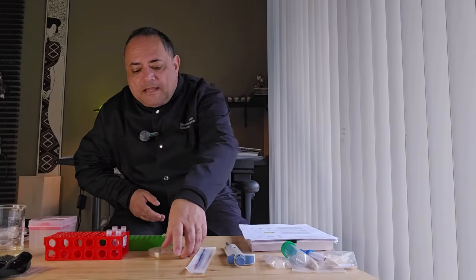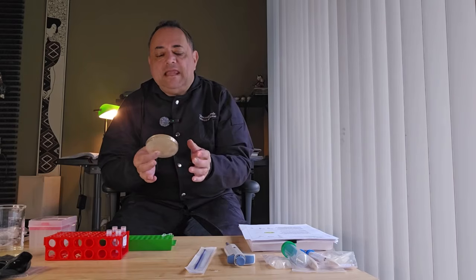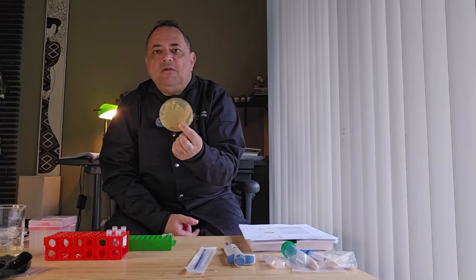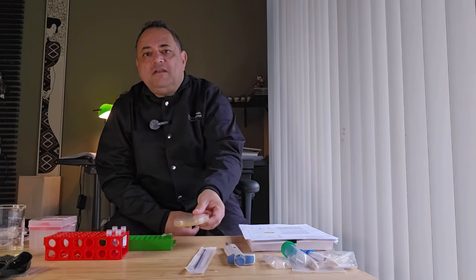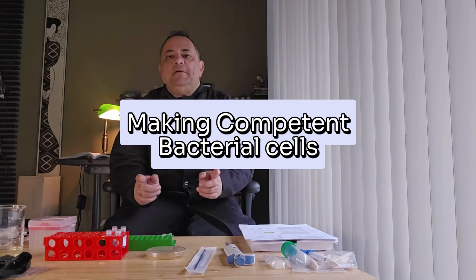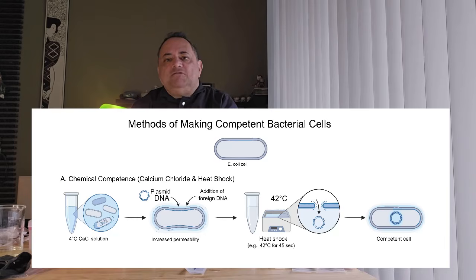Okay, so my LB agar plate has been incubating for a few days, and I have a beautiful growth of E. coli. So we move on next to making these bacterial cells competent. What do we mean by making competent bacterial cells? Basically, it means we are going to prepare bacteria so they can efficiently take up foreign DNA during transformation.